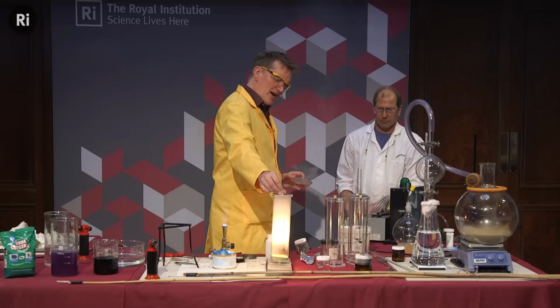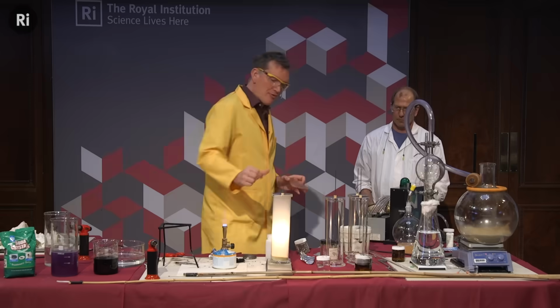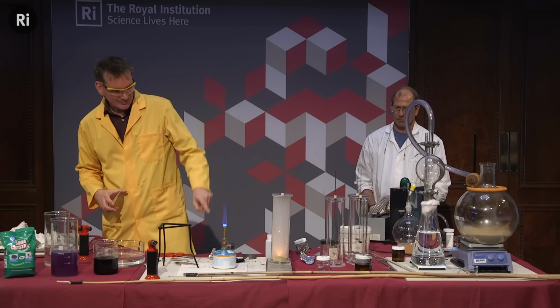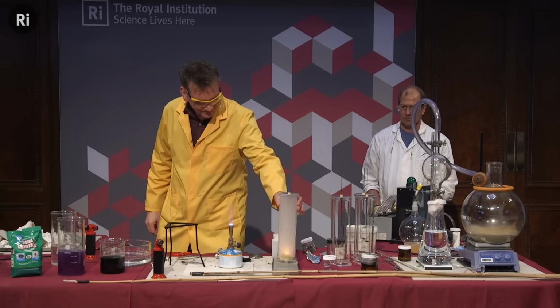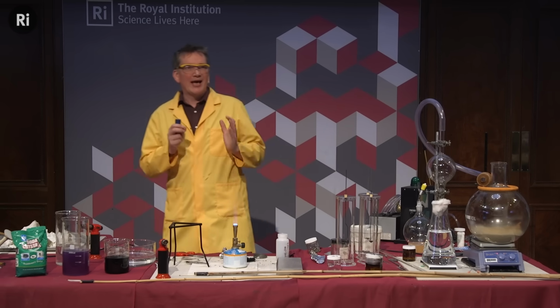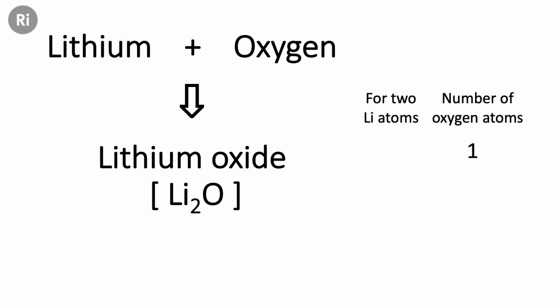So an incredibly vigorous reaction taking place there. In fact, this one is so vigorous that it's actually now the iron that's burning in the oxygen. That glowing thing is the iron, and the end of the iron has just fallen off, and my rod has got much smaller. I shall give that to Chris, thank you. But the formula of the oxide that we're making is Li2O. So like H2O, we have Li2O. So 2 atoms of lithium with 1 of the oxygen.